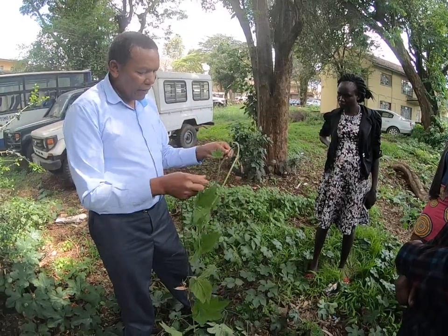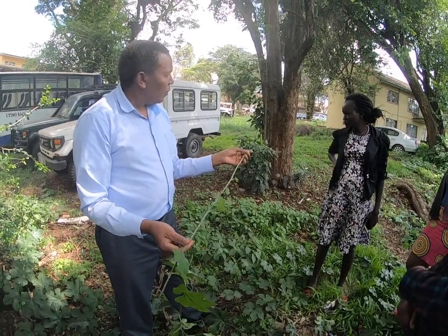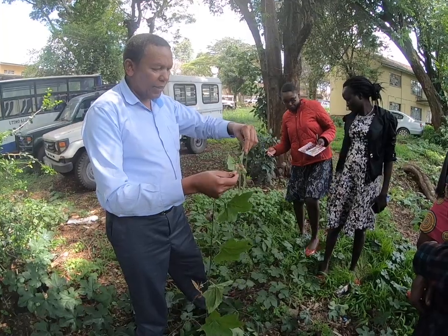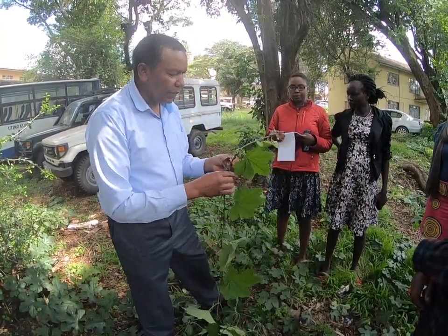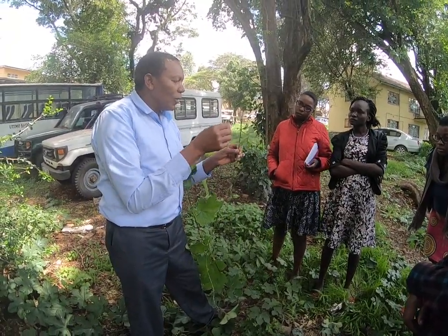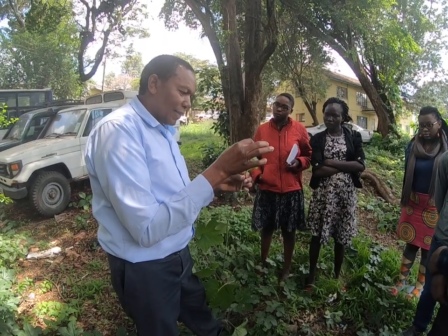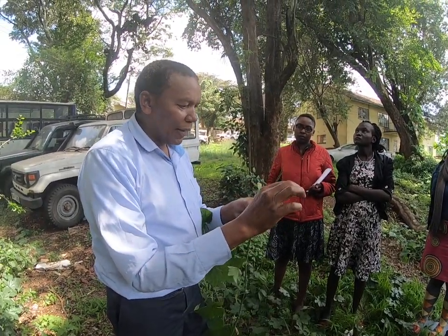Fingernails are good enough. So this is now our specimen. You may wonder why it will fit. I can fold it once it is there. So look at this. When you take this to the taxonomist, he will look at what we call characters. For example, one character is this. This is for climbing. The taxonomist will look at that.